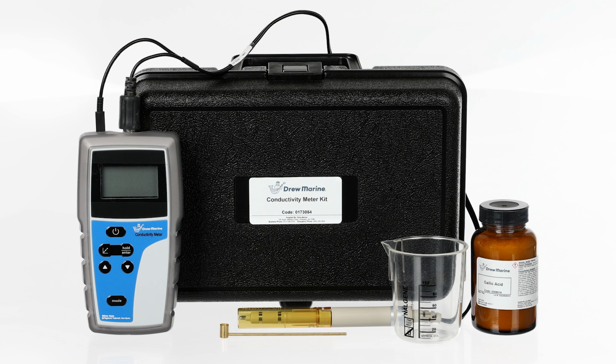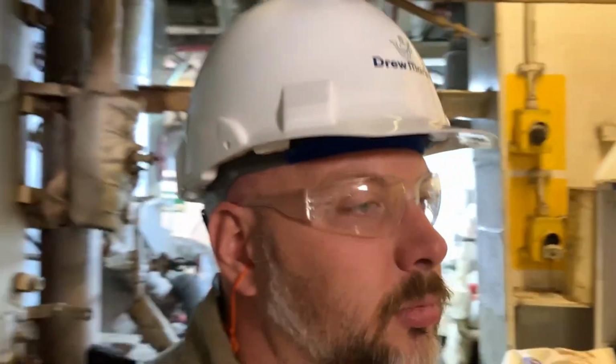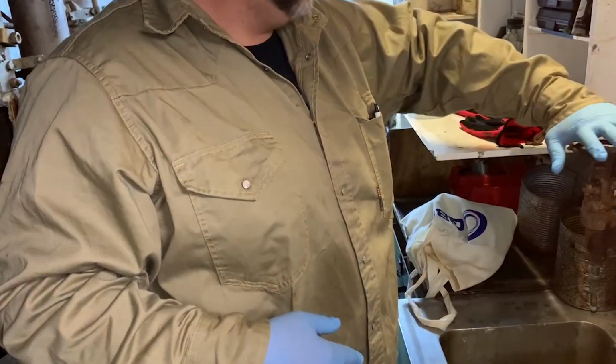This tutorial will demonstrate the specific procedure to determine the level of neutralized conductivity in a low or medium pressure boiler water sample. Proper range should be between 0 and 700 microsiemens. Before running the test, it should be ensured that the person conducting the test is wearing proper PPE and that they have read and understood the SDS.